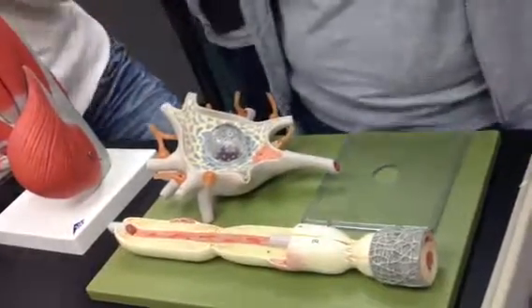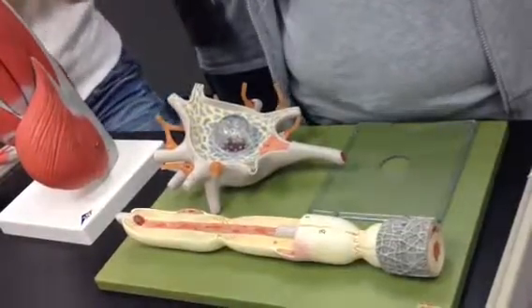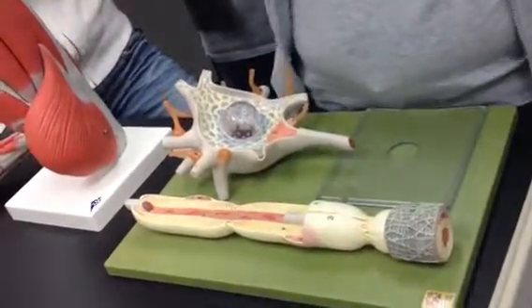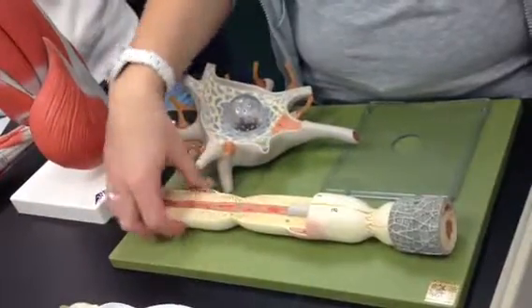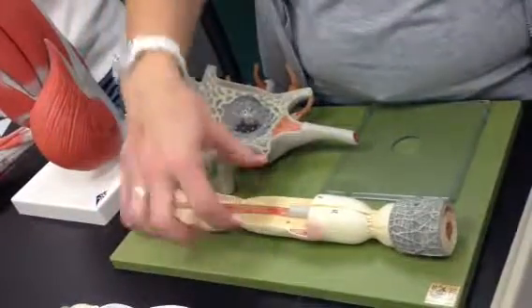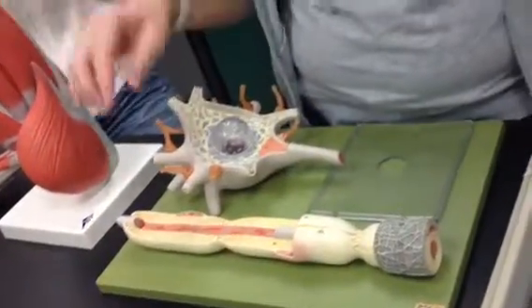But the oligodendrocyte is like one cell. Well, I can just explain it. You guys can look it up. It's like one cell, and it branches off and has little wrappings around lots of different axons, okay? The Schwann cells in the PNS are just like little bulbs of myelin sheath that are encased on each axon of the PNS.